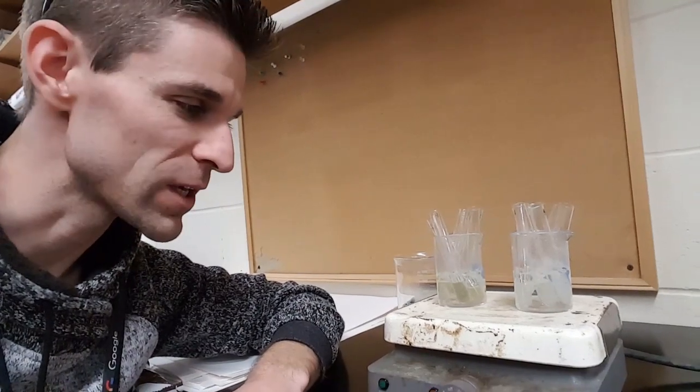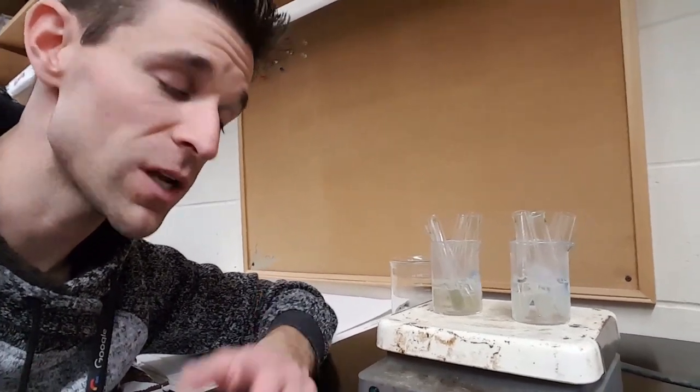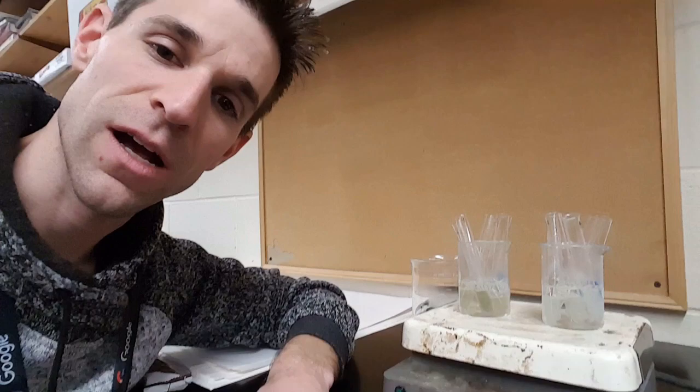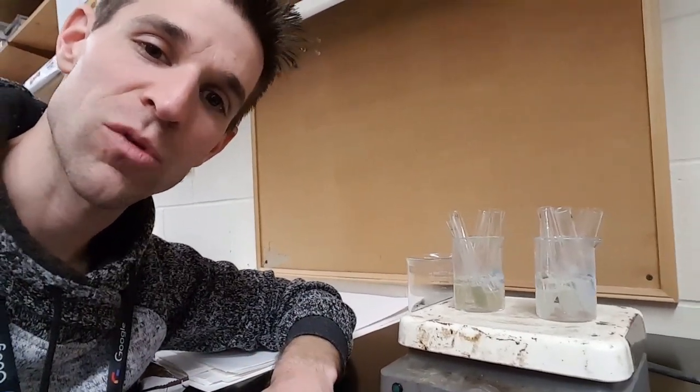I'm going to put it in another few test tubes. I'm going to run a second test so that we can see if maybe just something was happening with what we were doing in class. I'll see if I can replicate what we did and see if when I do it, there is any different reaction than when the class did it. So I'll do some new tubes. I'll boil them again, and we'll take a look at the results.